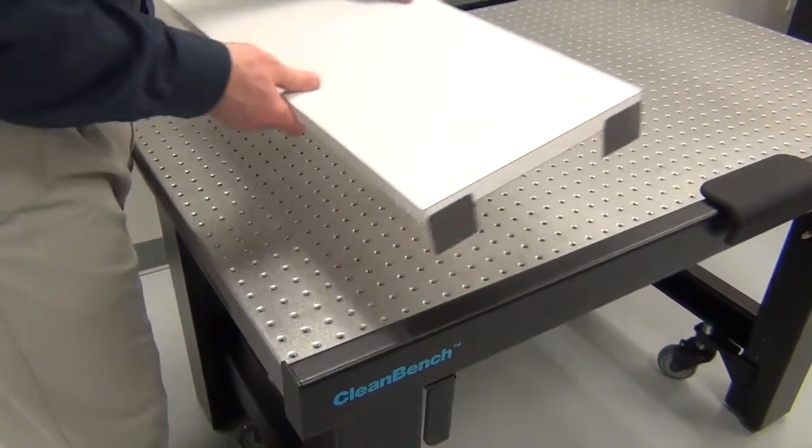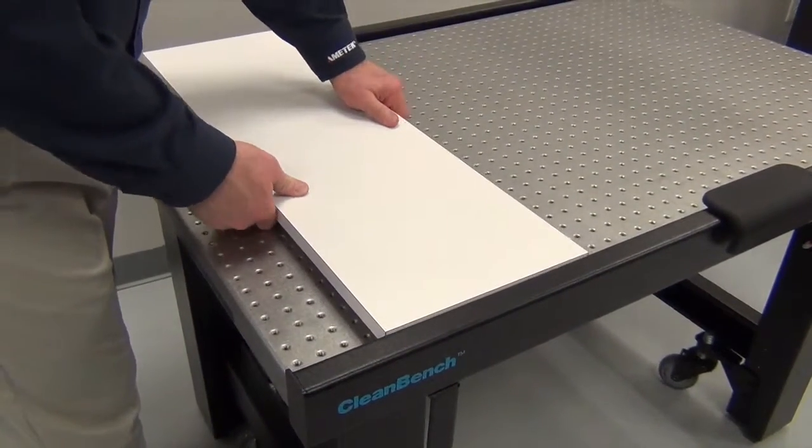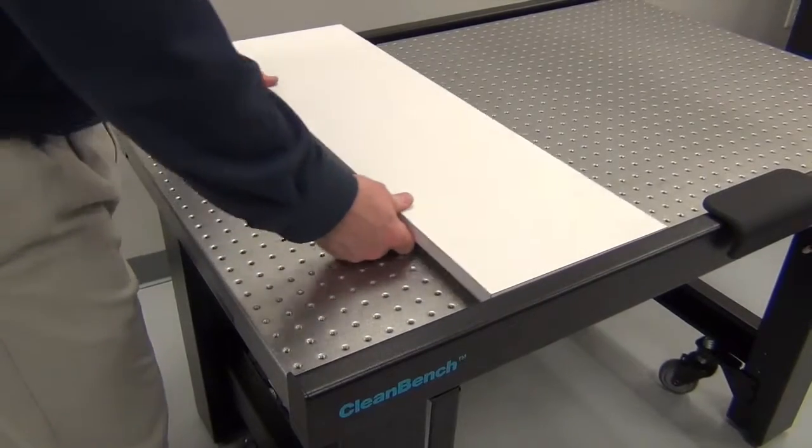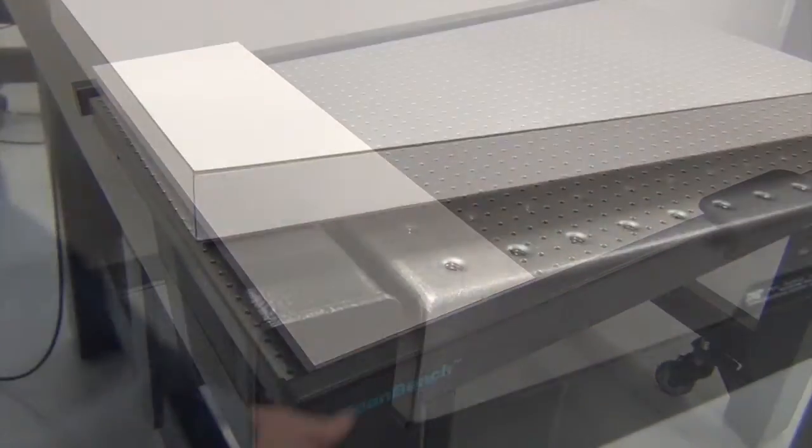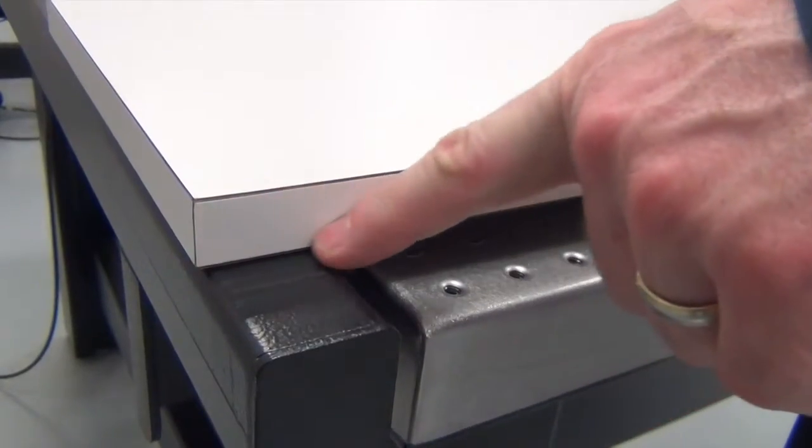Place the shelf with the clips in the slot on the back of the front support bar. The shelf is flush with the top of the front support bar and runs over the top of the rear support bar.